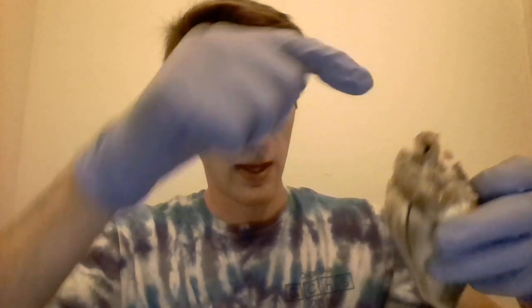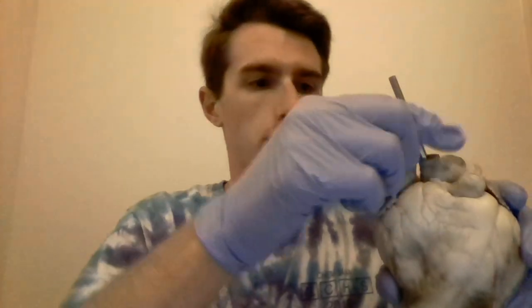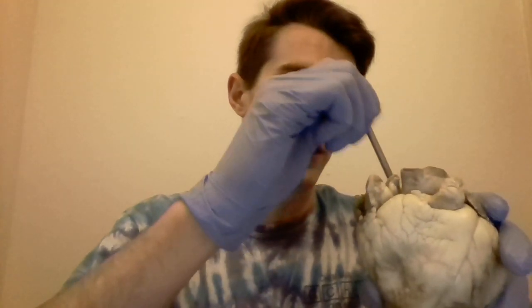Now we also have the aortic valve, which separates the aorta from the left ventricle. And I'm going to stick my probe here through the aorta so we can hopefully see that here within the heart. So in there is the aortic valve. And then we also have the pulmonic valve, which separates the right ventricle from the pulmonary circuit. And I'm going to try now to show that with the blunt probe here.